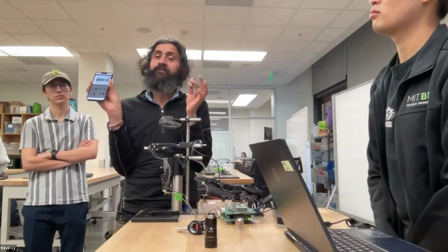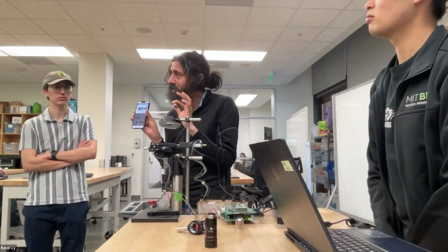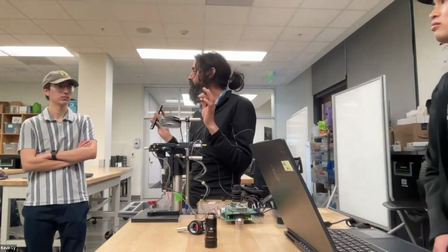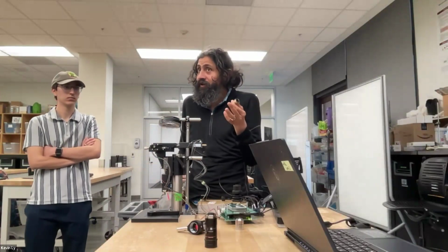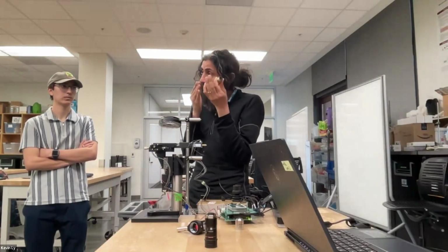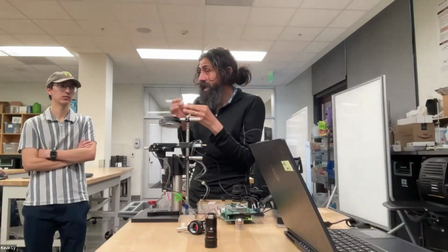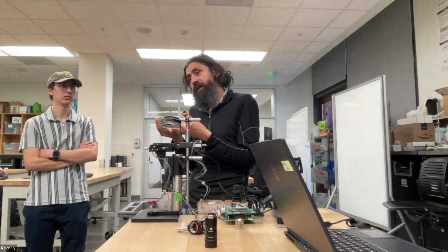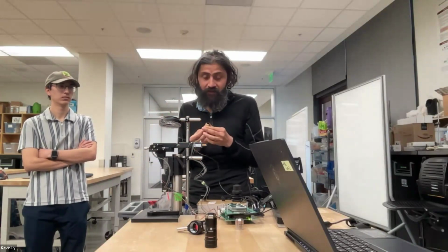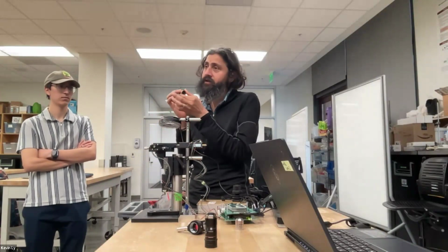So the problem in manufacturing lenses is not in making glass. We can make lots of glass. I can give you these 13, 14 lenses, but now align them with the same optical axis, all stacked together with really no errors in the lateral axis. That's what's hard. And that's really why objectives cost money. And that's why these things are built on templates.